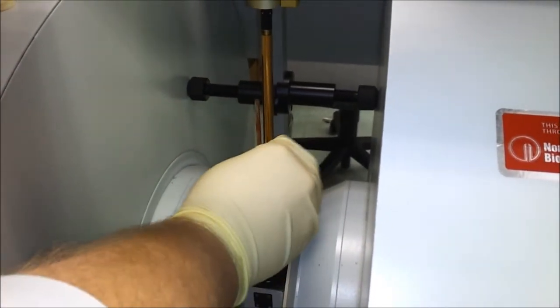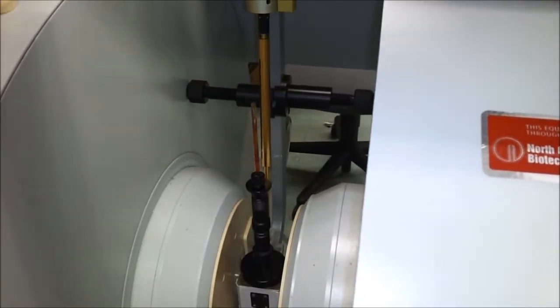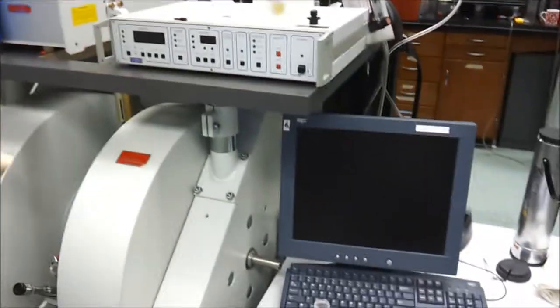Make sure it sits all the way on the bottom, tighten it up. And then if this were a real sample, we'd have the pumps running and you wouldn't be able to hear me, and we'd just set it up and scan it with the spectrometer.